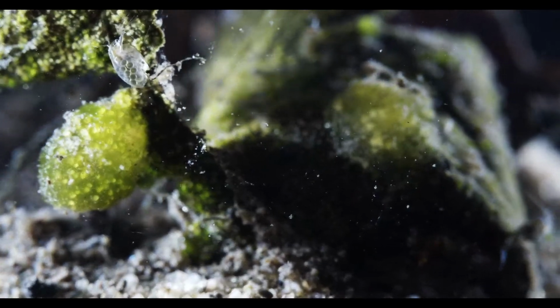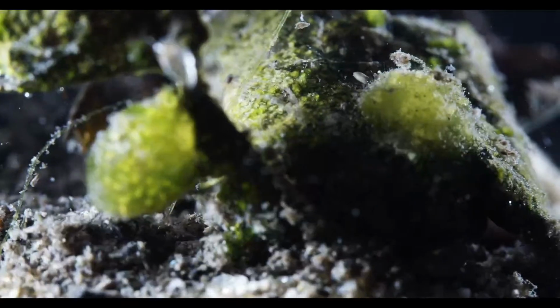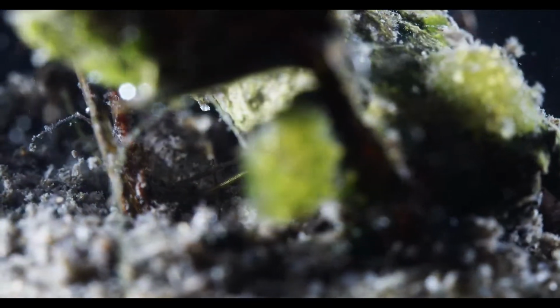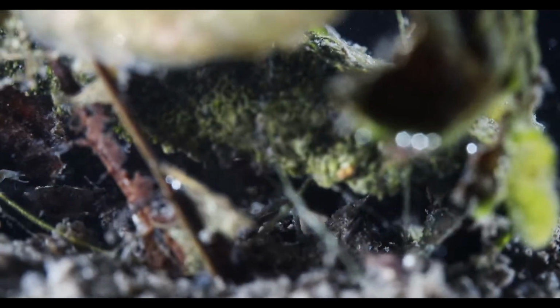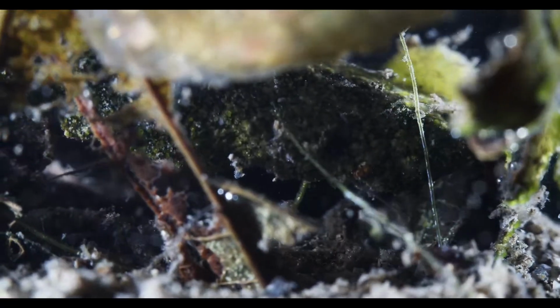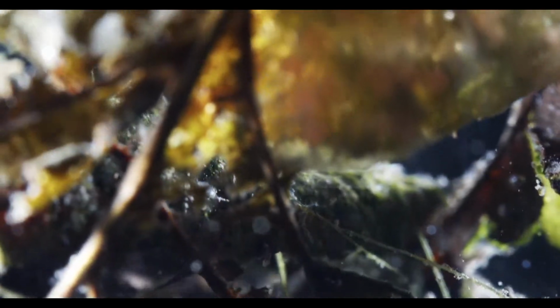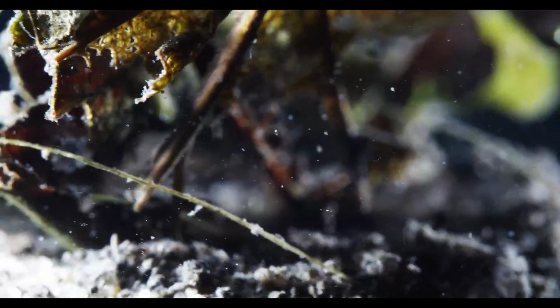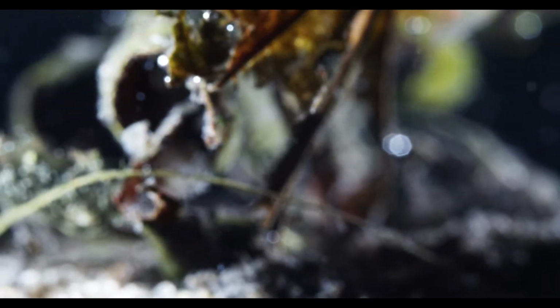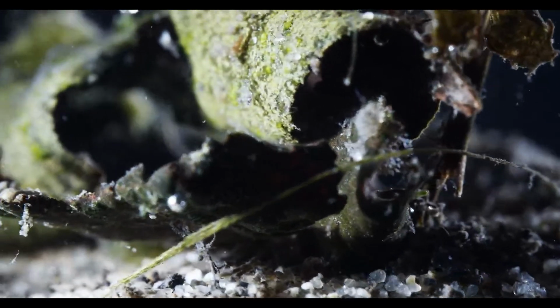Maybe I'll try to look at the bug first, because... oh, really? And there he is. It's just so fast, he's a bit hard to follow around, because if I move the machine too fast I get vibrations, unfortunately. Kind of have to get lucky, and he has to kind of chill for a second somewhere where we can get a look.